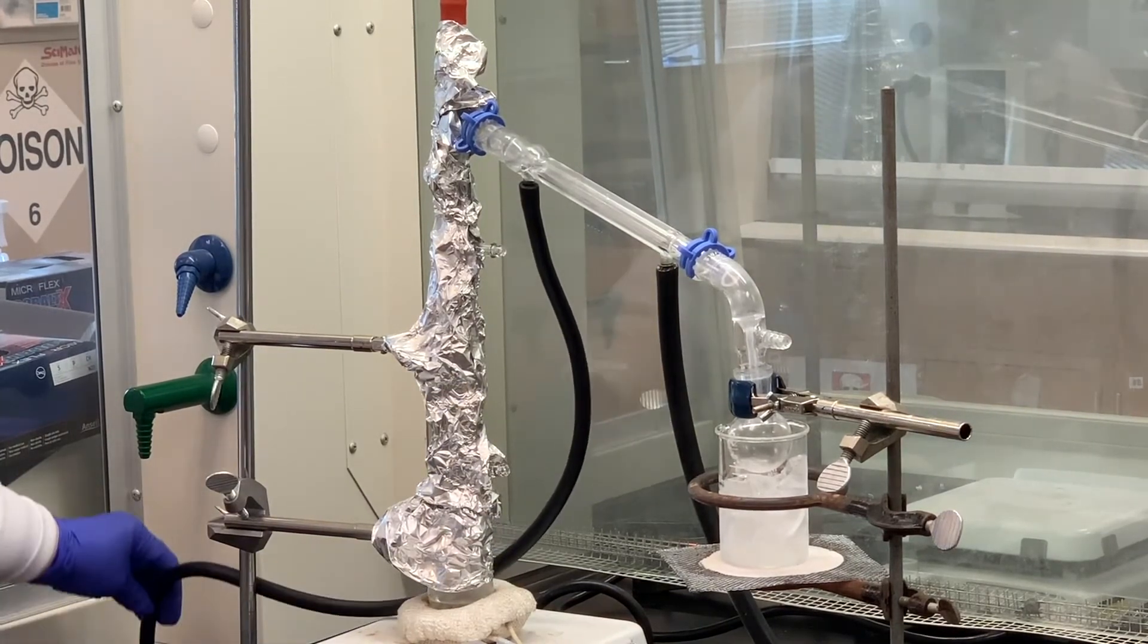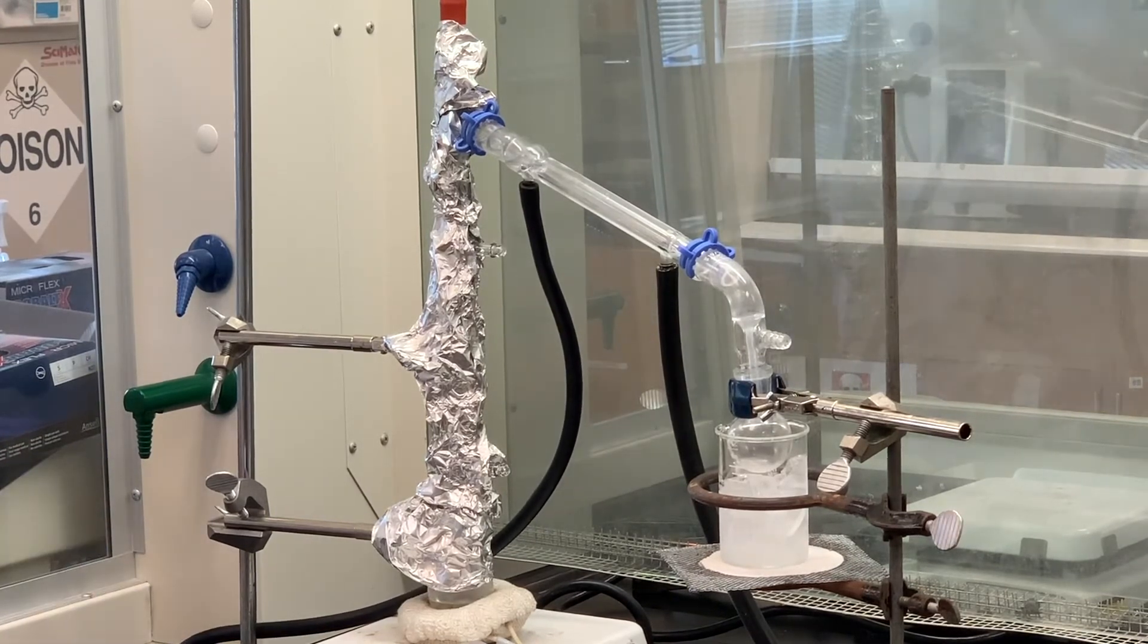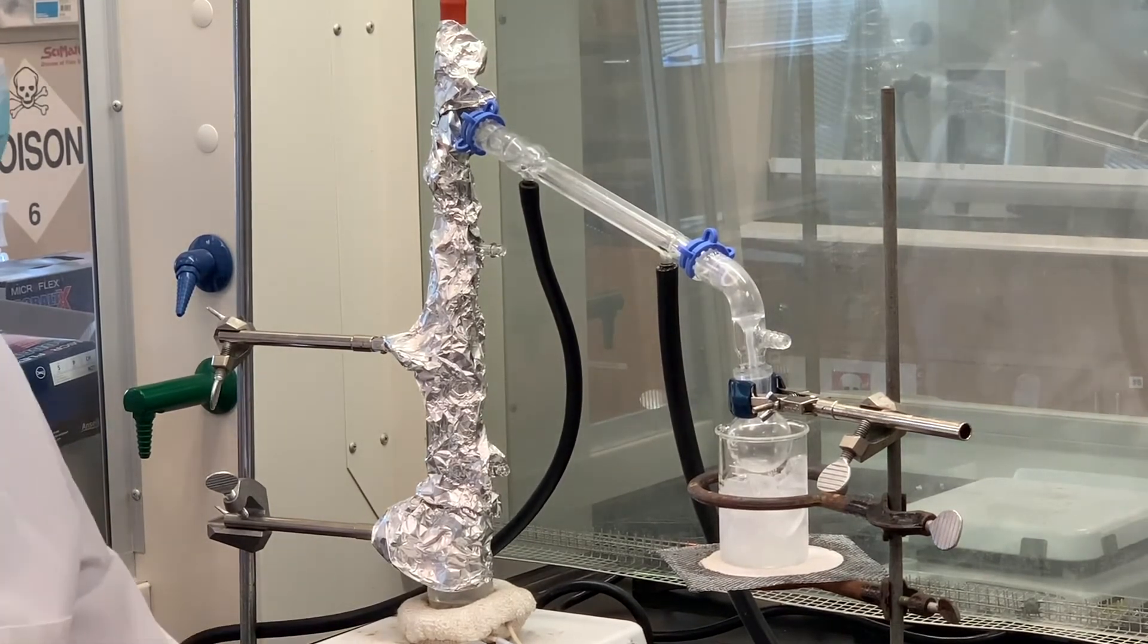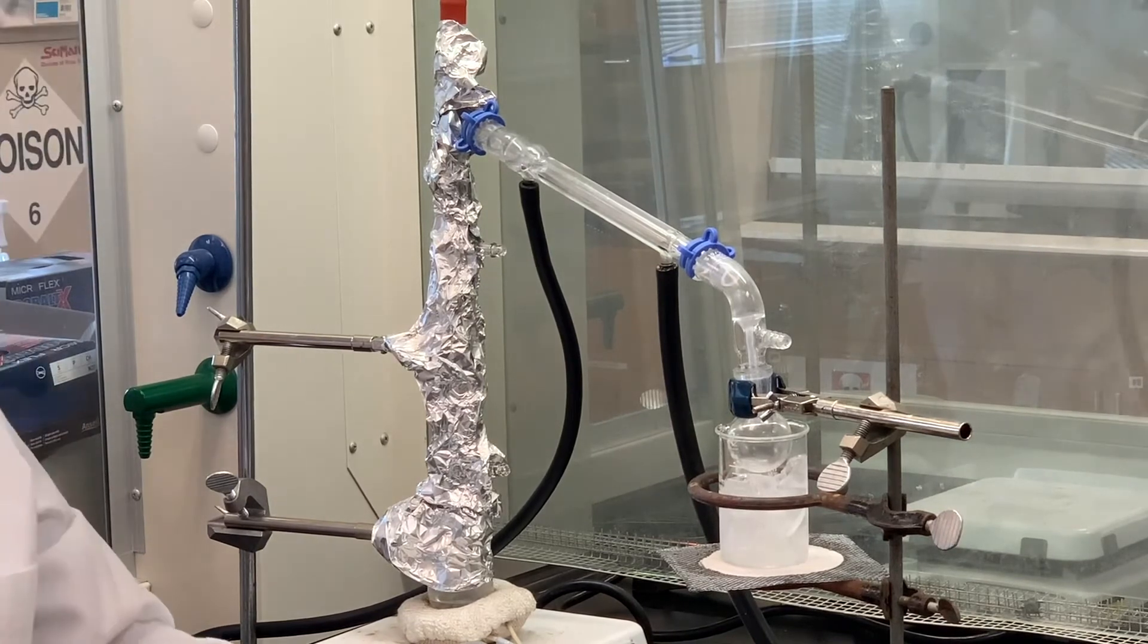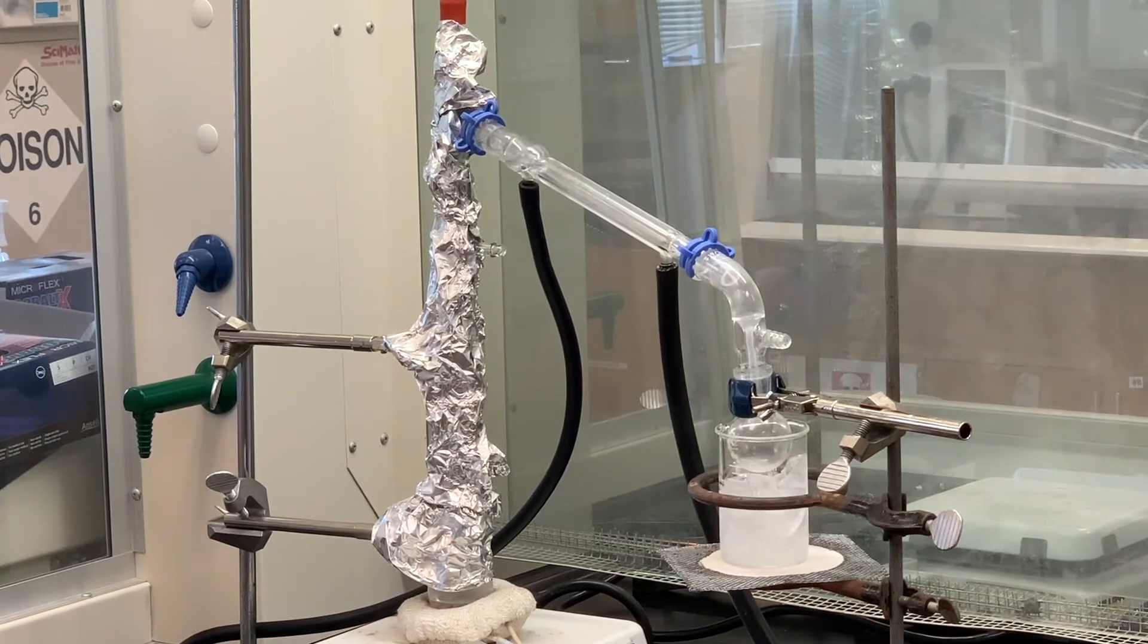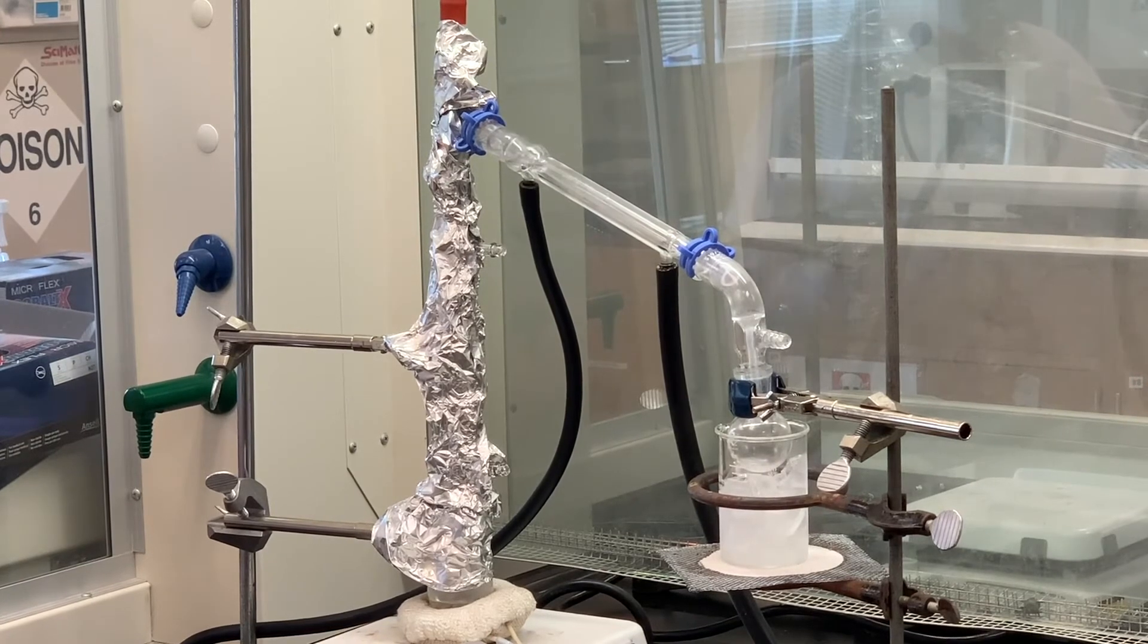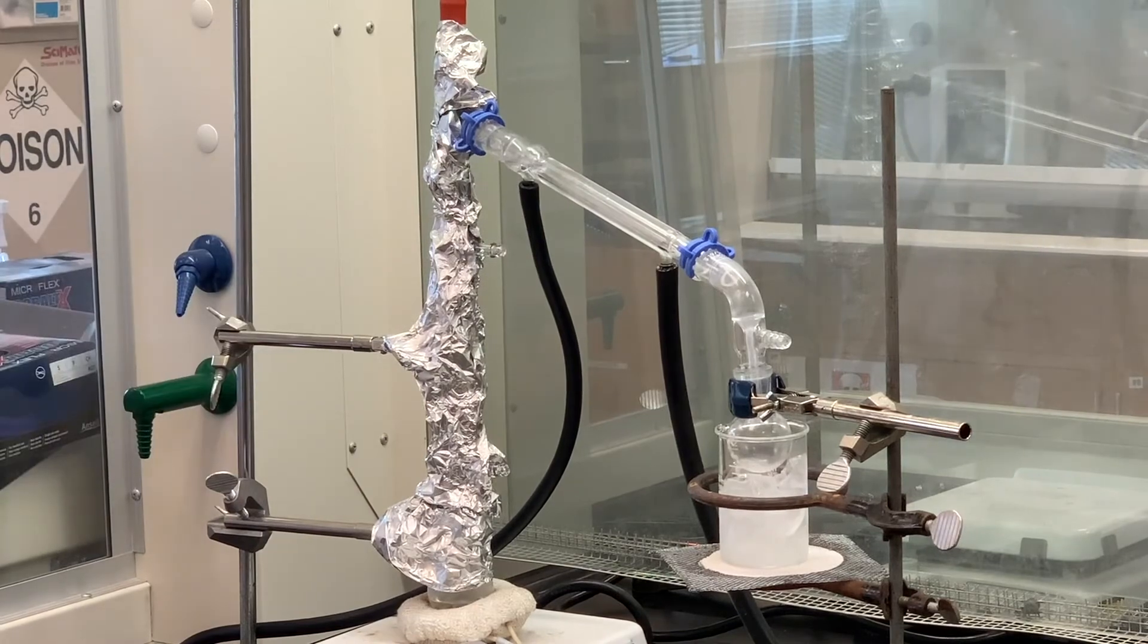I'm going to periodically check my water still coming out. And then I'll probably heat this. I've got this set. And again, each Variac is different. I have this around five. And I want to kind of heat it somewhat gradually. And then I'll probably have to eventually turn it up to high or close to that just so that we can collect the cyclohexene as it comes over.